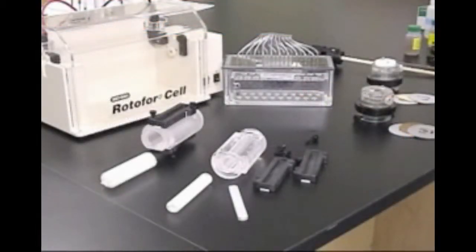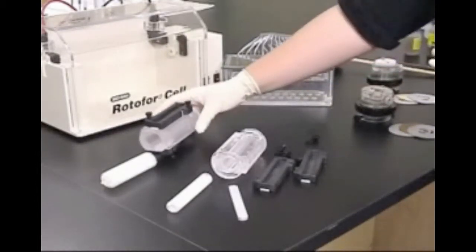In this video, we will use the standard focusing chamber to separate the protein standard that is supplied with the Rotofor Starter Kit.